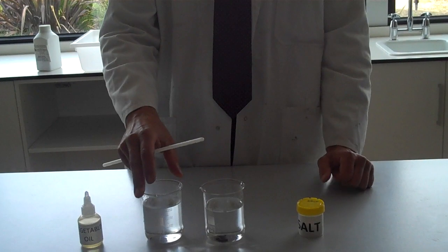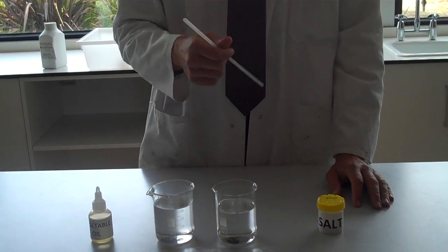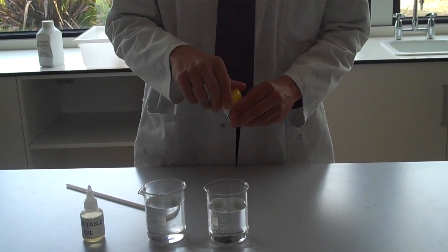So it's very simple, we're just adding these two substances to the warm water, stirring, and then basically making some observations. So very simple experiment. We've already made our aim and our prediction.